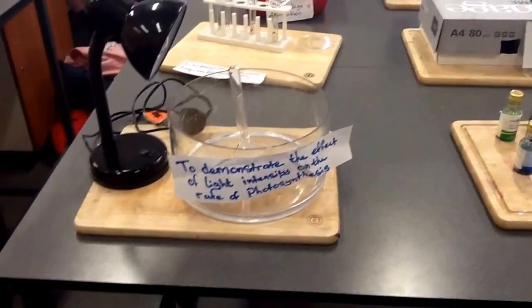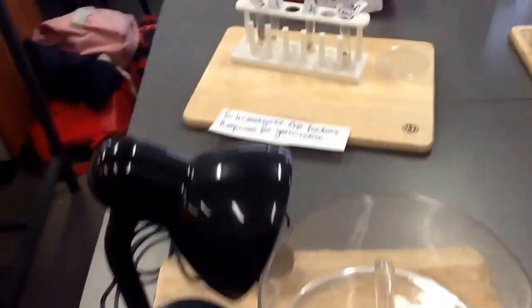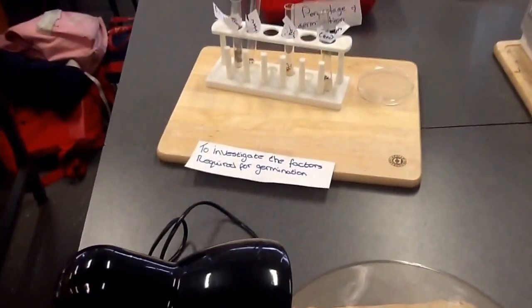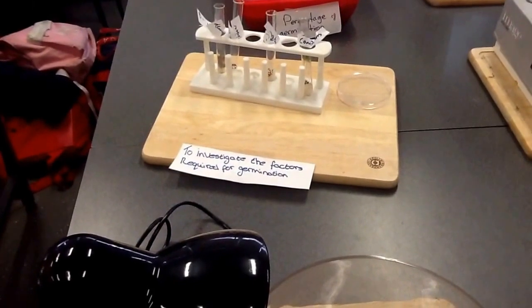The next experiment is to investigate the factors required for germination. These factors are heat, oxygen, and water.